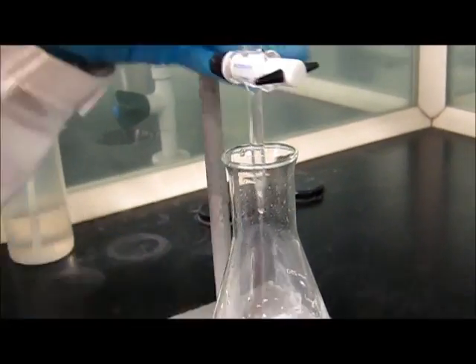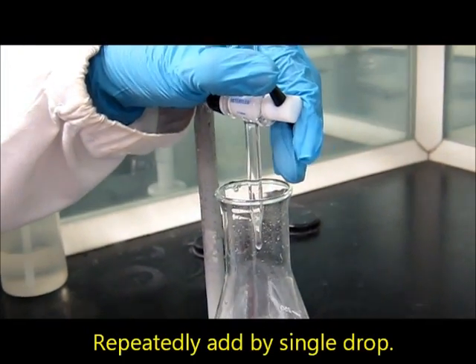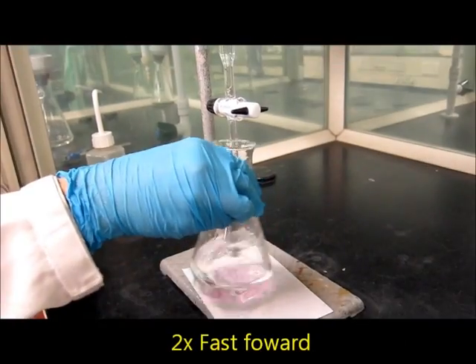Now, add the titrant repeatedly dropwise. So, you see, two times fast forward.